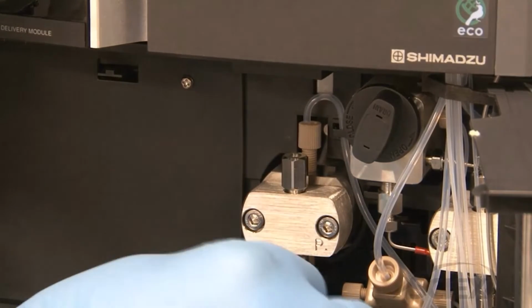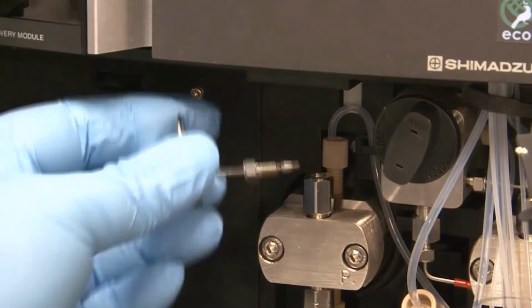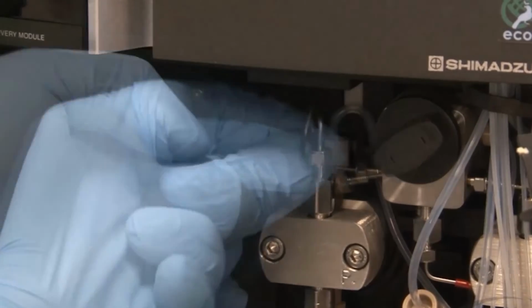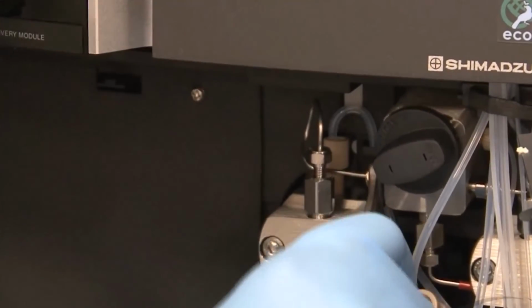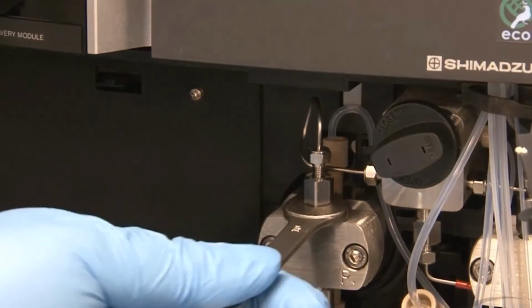Connect a P connector to the inlet check valve. Attach the stainless steel pipe to the outlet check valve and the purge assembly. Tighten the fitting connected to the purge assembly using an 8mm wrench. Then hold the check valve and tighten the other fitting.